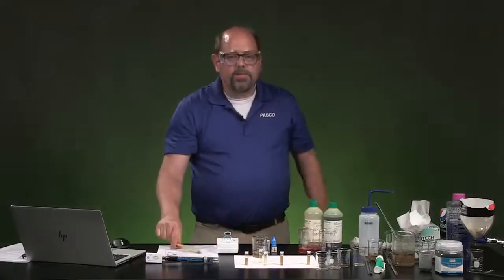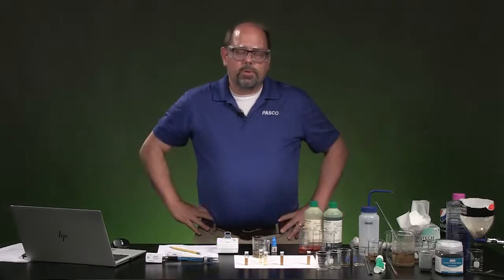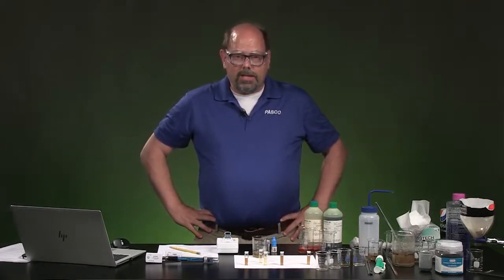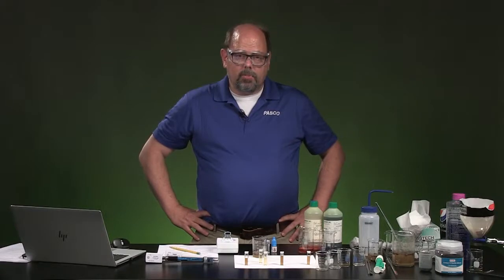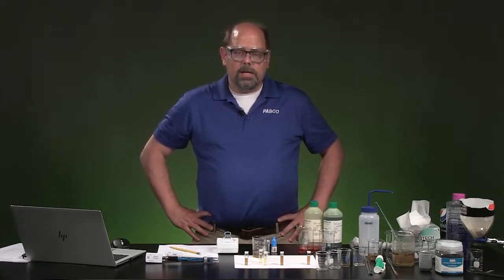All right, so now we've taken all the data. You should be able to go in there and think about what that means in terms of interpretation. We'll come back and talk about the challenge and what we should do to interpret these results and the analysis in just a second.